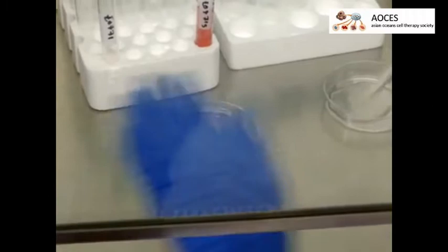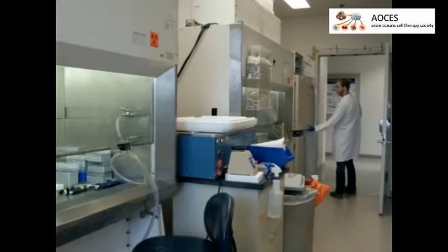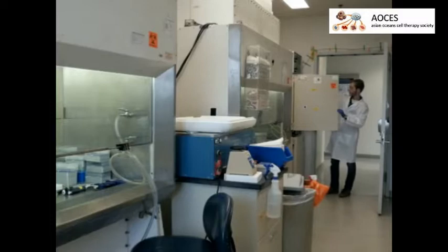Next, pipette 5 milliliters of sterile PBS into the bottom of the 10-centimeter dish. Carefully invert the lid and place it on the 10-centimeter dish. Then incubate the hanging drop cultures at 37 degrees Celsius and 5% carbon dioxide for up to 72 hours to form spheroids.